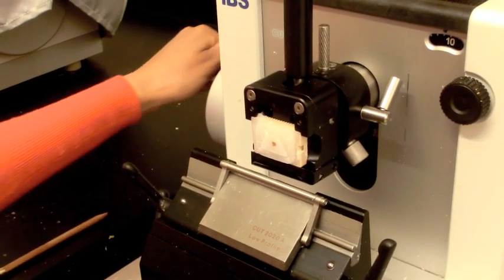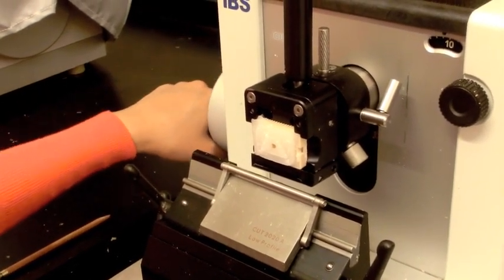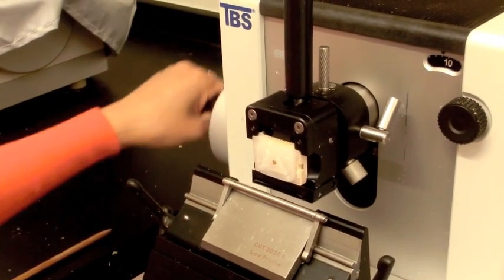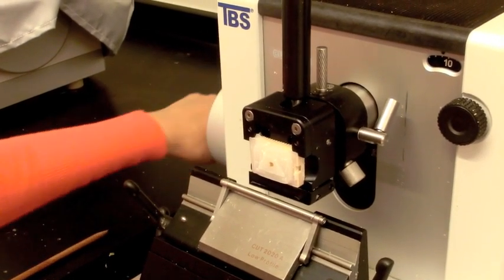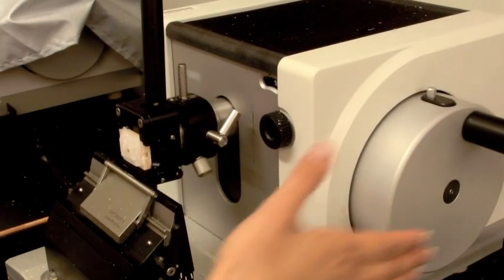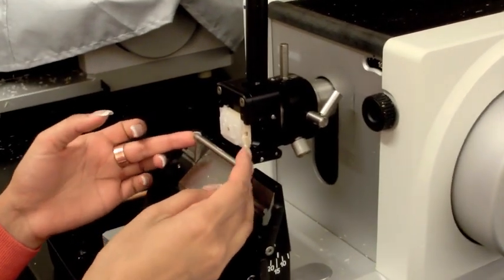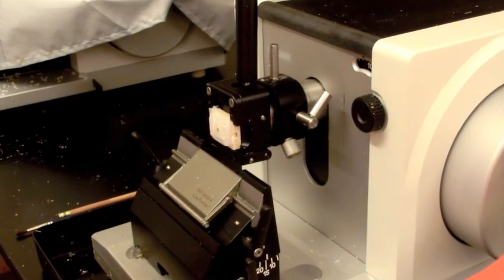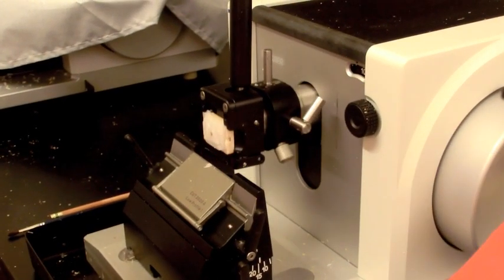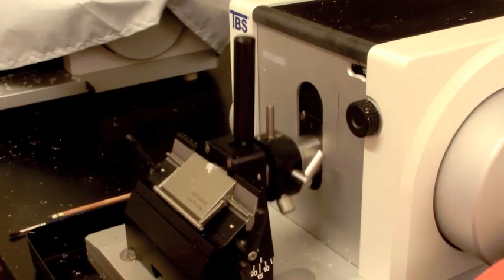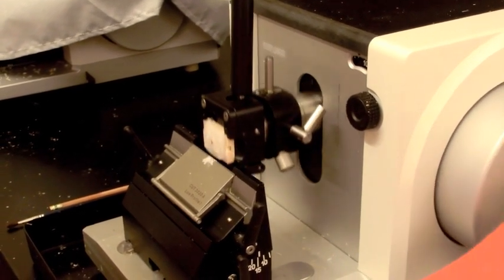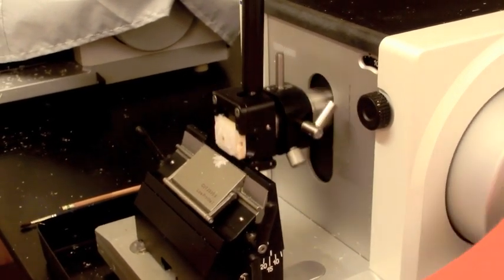Adjust the stage with the wheel on the left to move the paraffin cartridge close to the microtome blade. Unlock the wheel on the right by pushing the pin button down. Place both hands on either side of the finger guard and pull it down to reveal the microtome's blade. Remember to always lock the wheel into place when you are not sectioning.